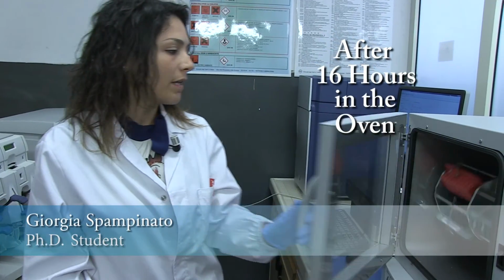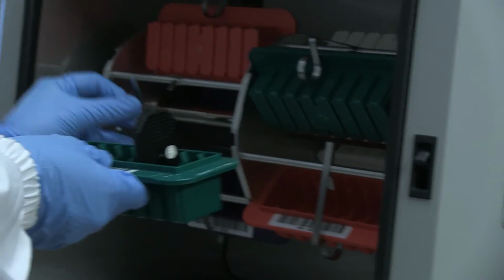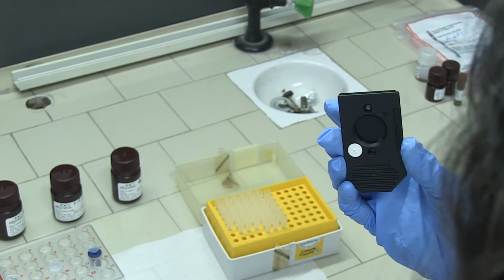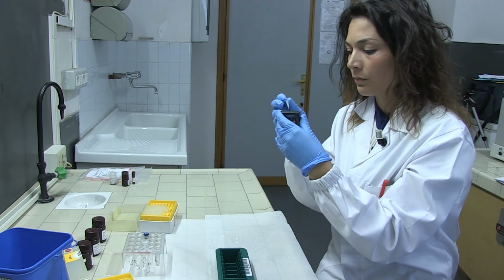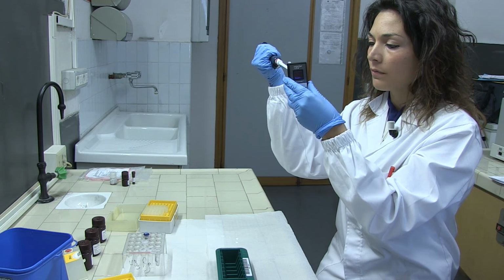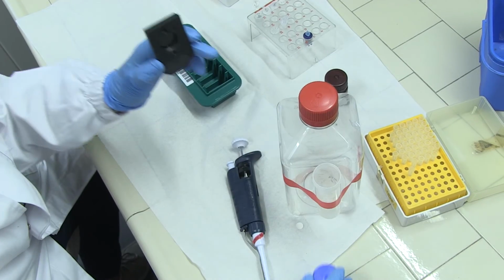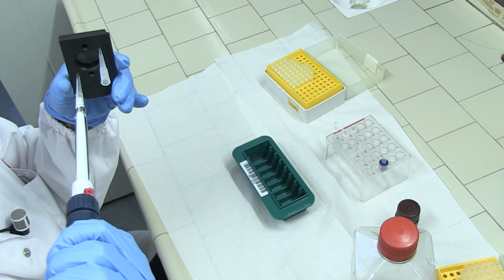After 16 hours, the microarrays are removed from the oven. The hybridization mix is removed from each array. Each array is filled completely with the wash buffer.